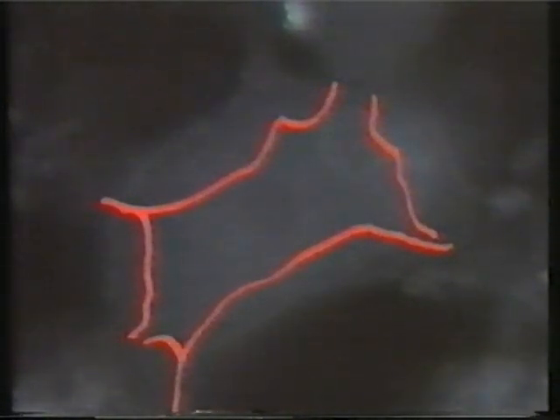The shrinkage with Palmgren stain in a number of cells turned out to be to about 20% of the original area of the same cell. Finally, let us look by phase contrast microscopy at the effect of osmic acid staining as is done for electron microscopy. Here's the unfixed cell.